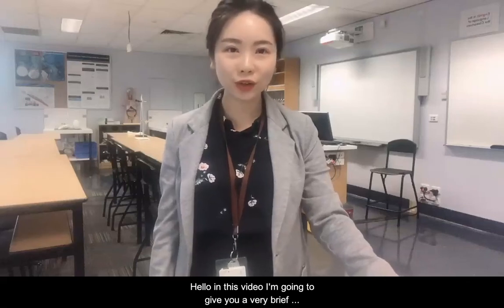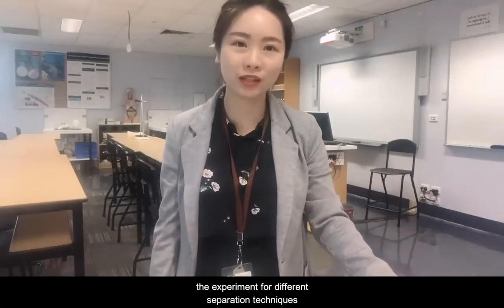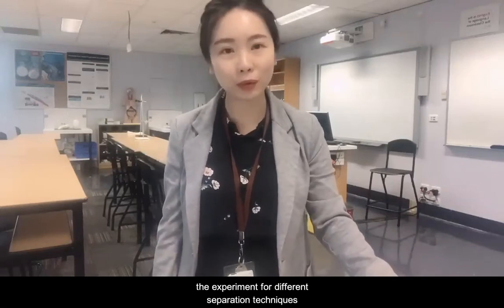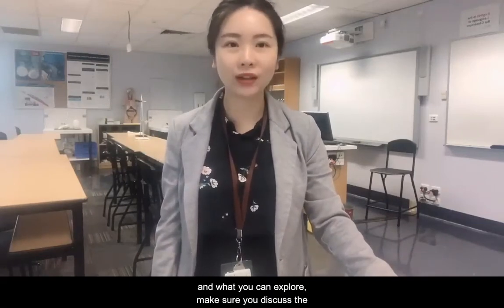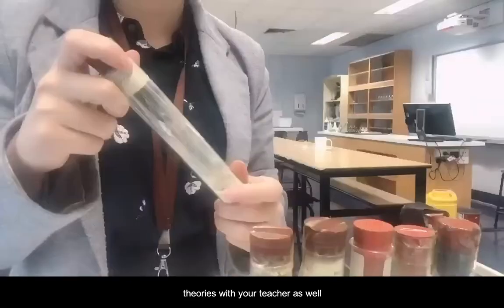Hello, in this video, I'm going to give you a very brief introduction on how to set up the experiment for different separation techniques and what you can explore. Make sure you discuss the theory with your teacher as well.